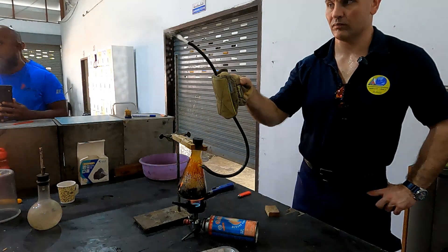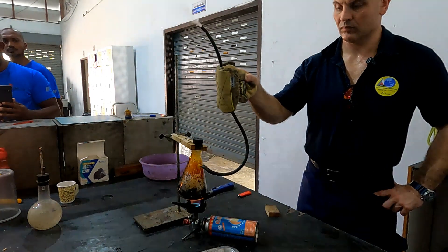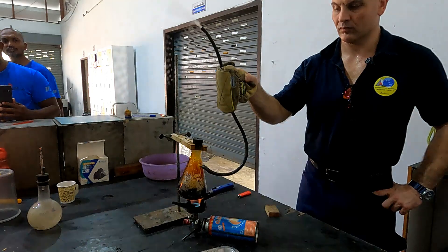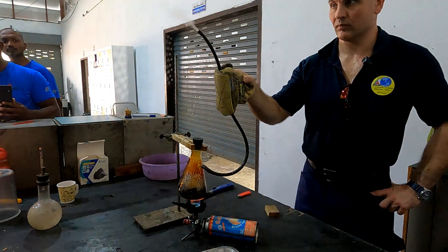It's a low temperature reaction — as low as 150 degrees Celsius for some plastics, up to 300 degrees Celsius for wood.